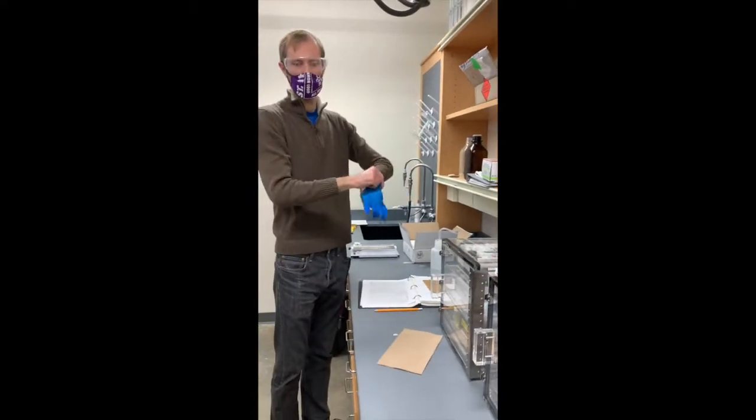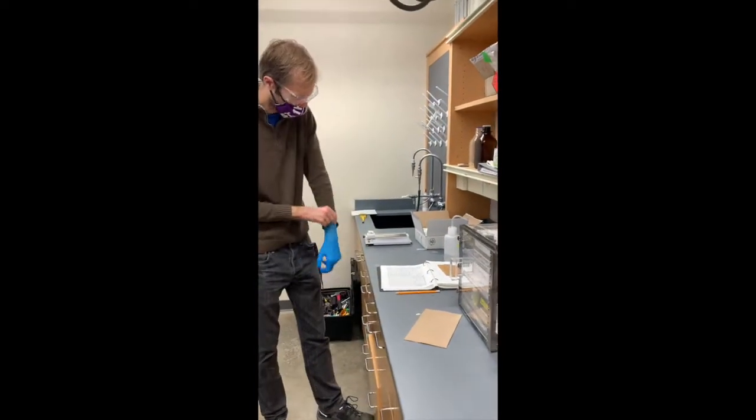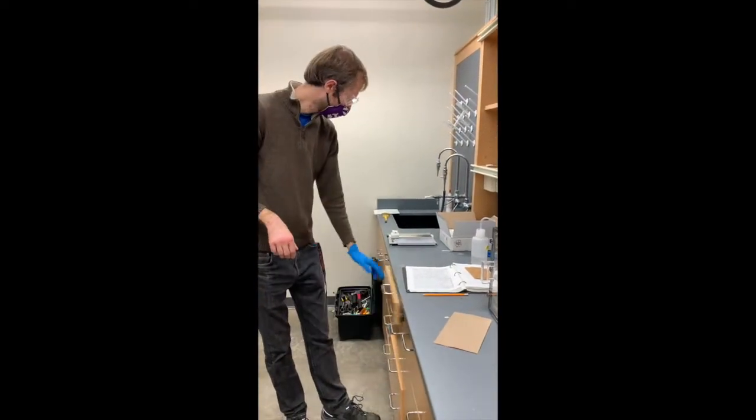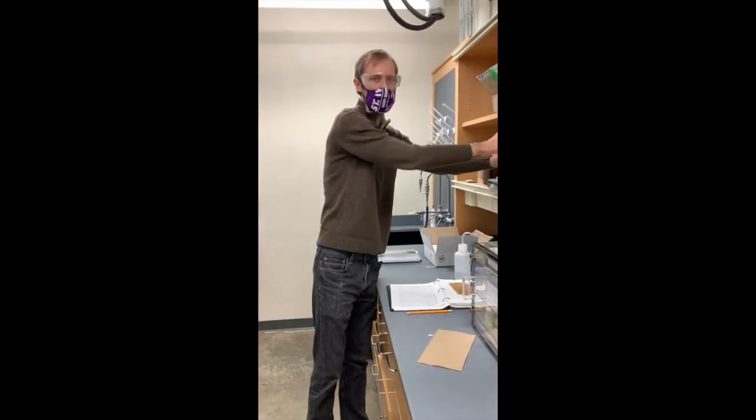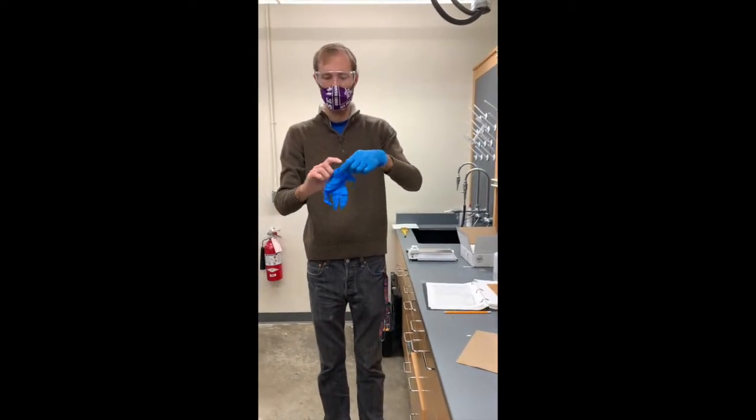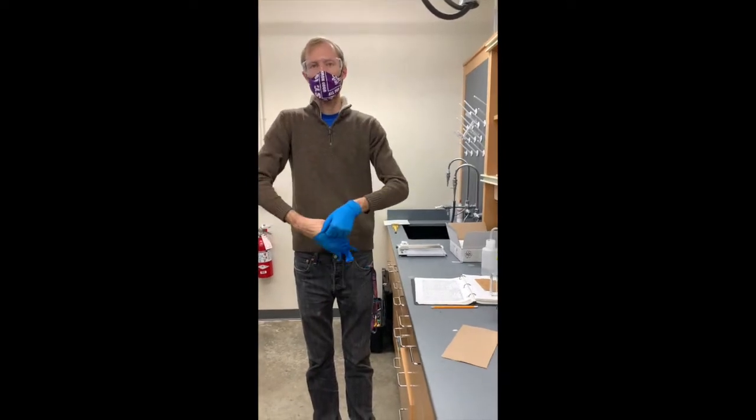And you can also use cotton gloves for this. We might have some in some of these drawers. Yeah, I can't find any, but those are something that you can get in the store room if that's more comfortable for you. It's really up to you.